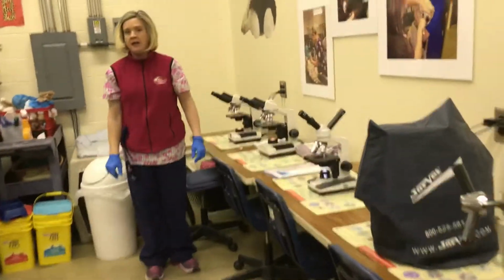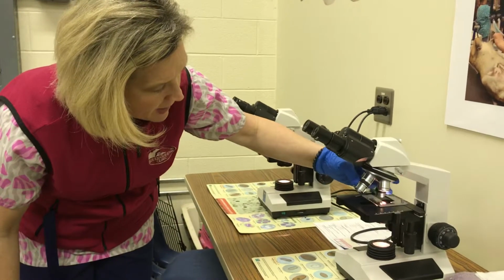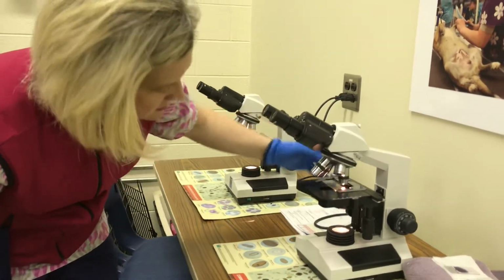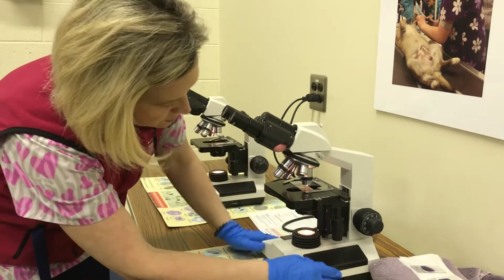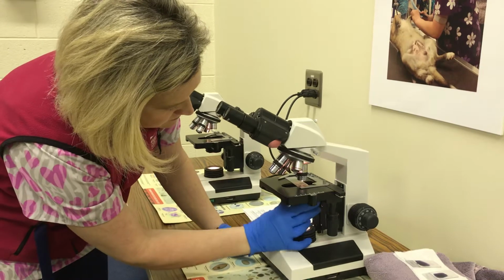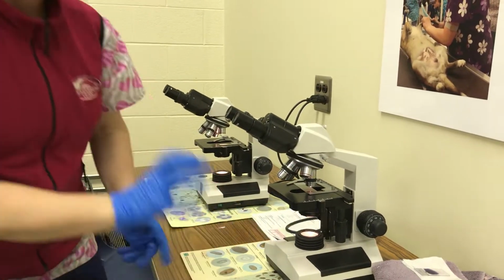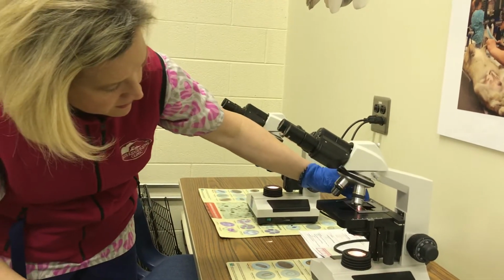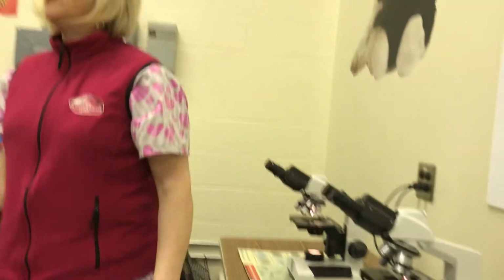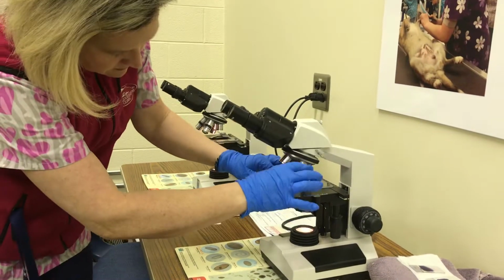When we are looking at our sample under the microscope, we're gonna put it on 10 power first with a low light. So we're gonna turn our light down. If not, it will burn through the cells and you cannot see them. So we're gonna get it into magnification, and then we can go all the way up to 40. You do not go to 100, okay, with the urinalysis. So 10 to 40. Okay?